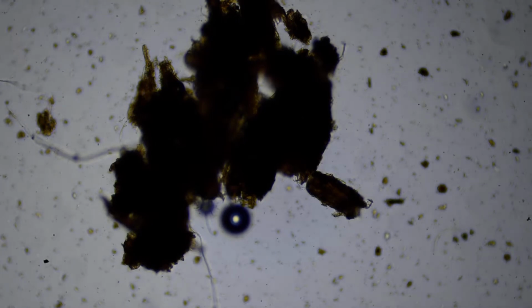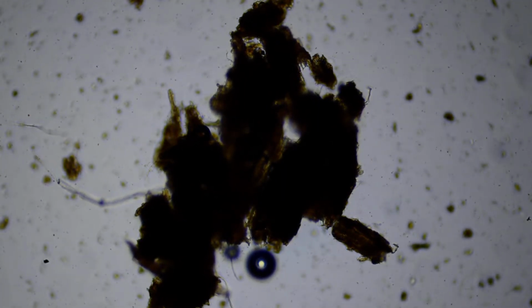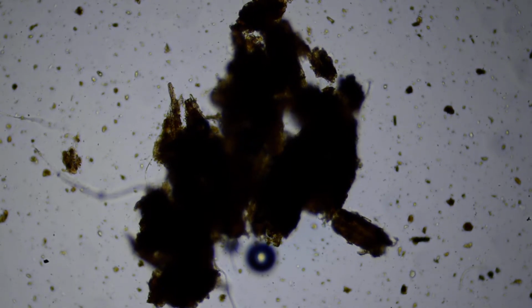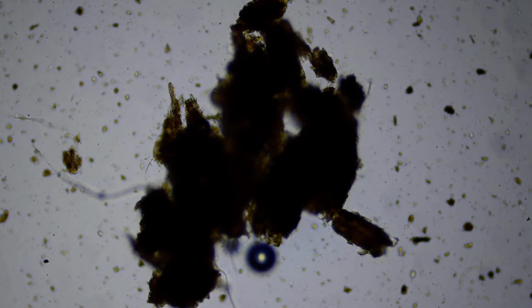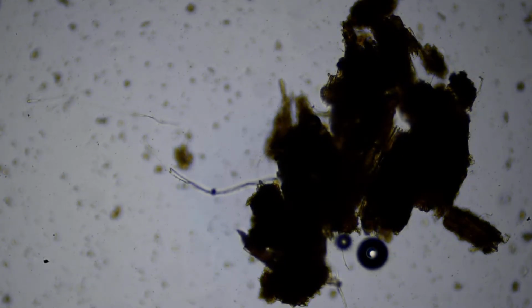And I just have to focus with my microscope. The microscope and the camera are not the same planes of focus, so it's a bit awkward. So yeah, this thing here is an aggregate, and we can tell it's like fulvic acid probably because of its honey-coloured appearance. You can see at the edges there, and the darker bits in the middle are probably not humic acid. Humic acid does have a darker appearance, but I think it's just because the light can't penetrate all the way through, so it appears shadowed basically.